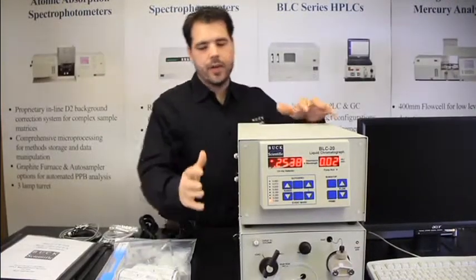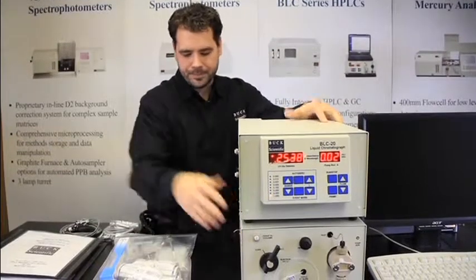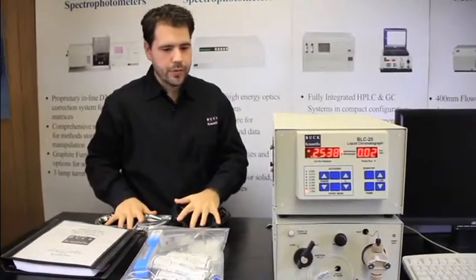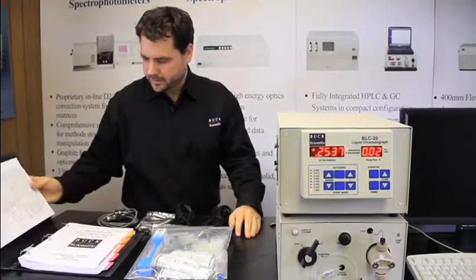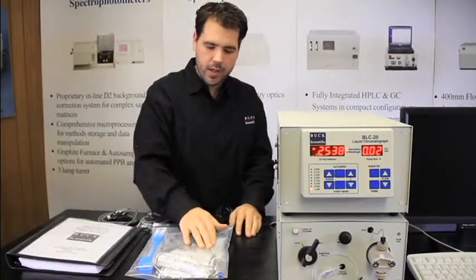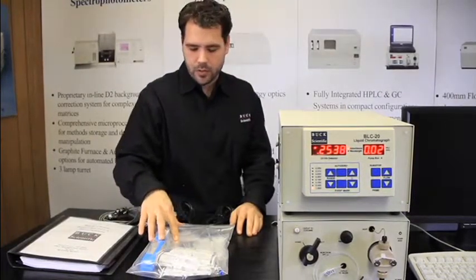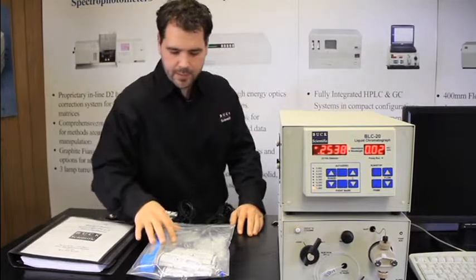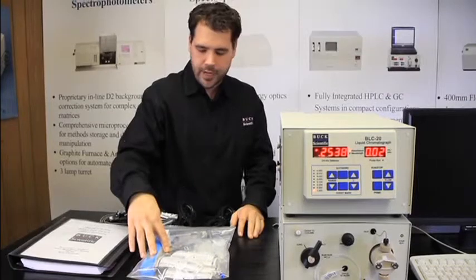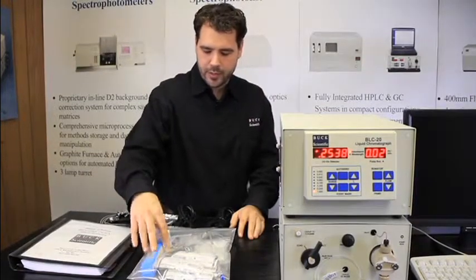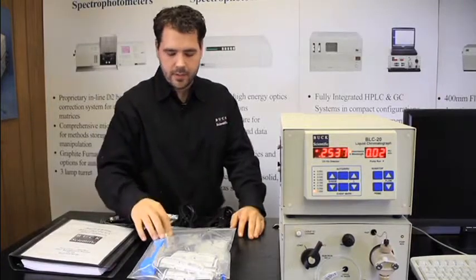Unpack the instrument and you should find our detector chassis, a pump chassis, several cords for connecting the two, a manual with the software needed to run the instrument, an HPLC column and syringe, fuses and hex keys for maintenance, some sample prep material, the tubings and fittings for connection of the instrument, and an HPLC test sample mix.